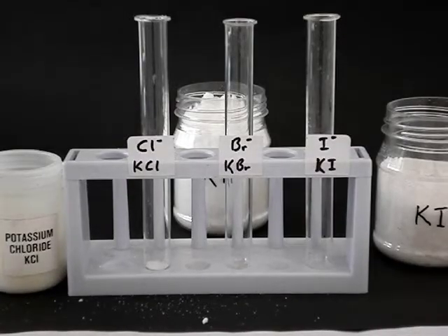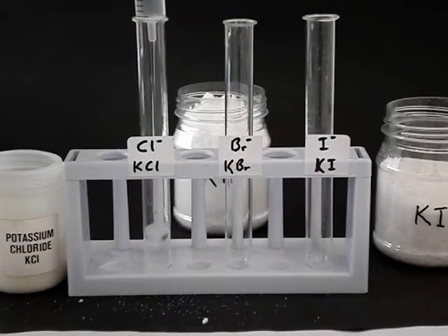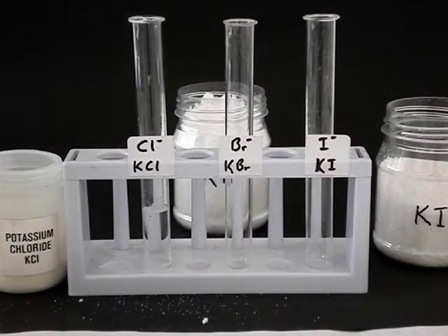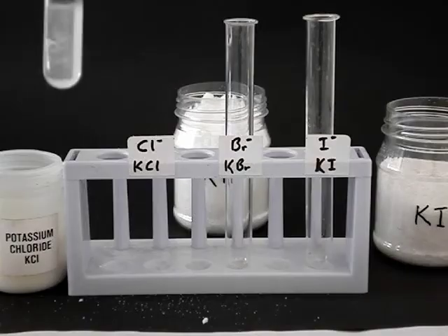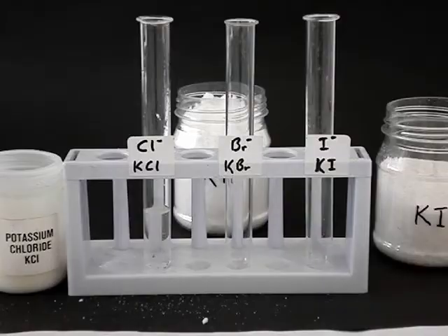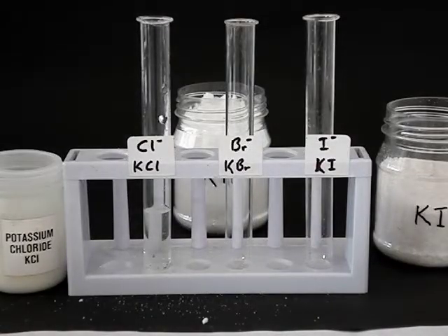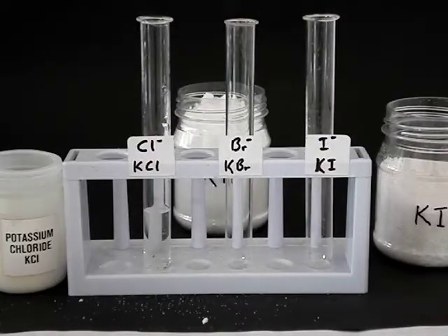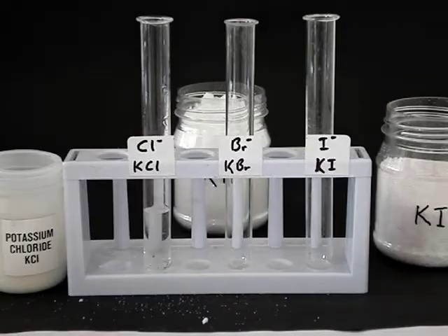When we add a bit of water, we can make a solution, and that white powder dissolves. You might need to shake it up a bit just to aid dissolving. You can no longer see where the white particles are, because the water has dismantled the crystal lattice and made a solution. In so doing, it has separated the positive potassium ions from the negative chloride ions, making them free to move around.